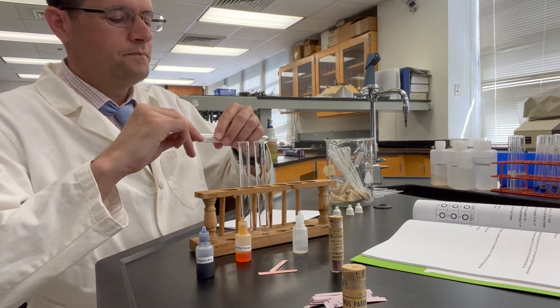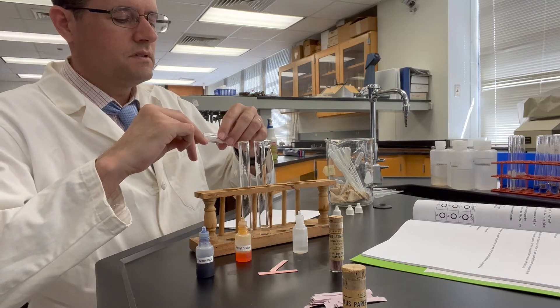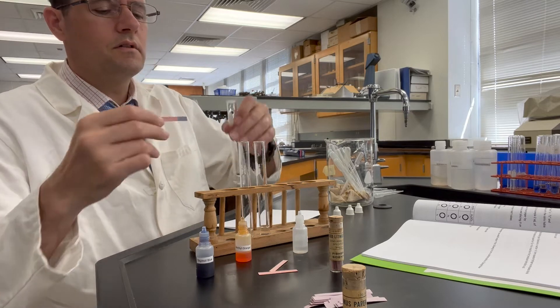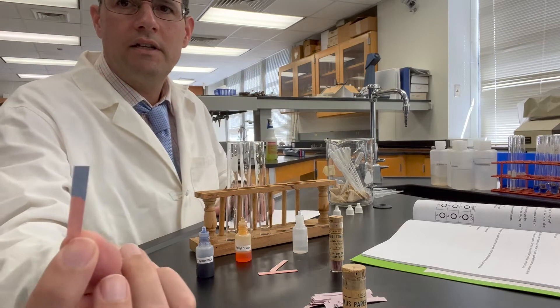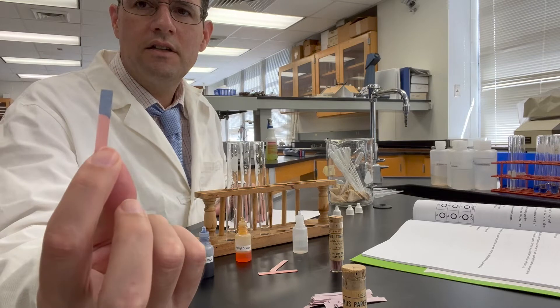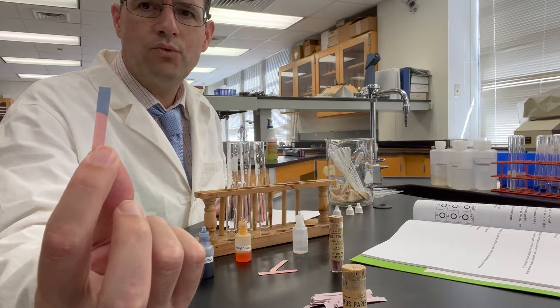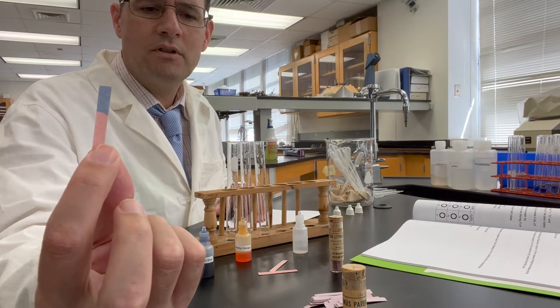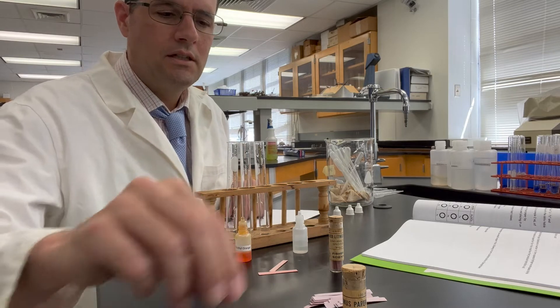And that's quite easy to see — I don't need to hold my paper up to that. So that's red litmus paper in sodium carbonate.